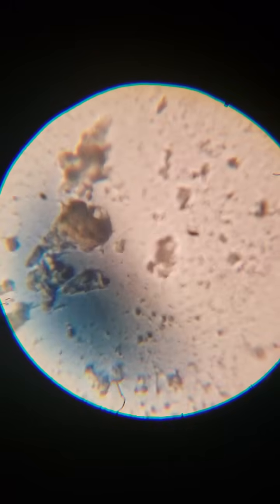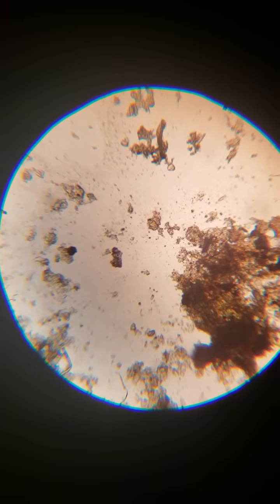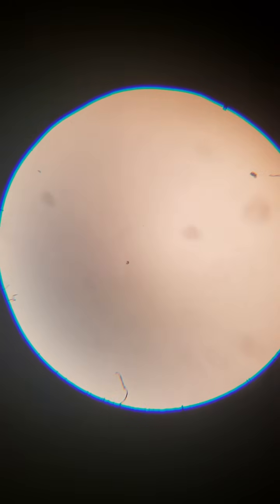But yeah, there's just an incredible world in here. And I just wanted to make it clear that once you have the microscope, you're not just making things up. You're actually seeing a whole world and able to decide what the heck you're looking at. So that's what your filter floss looks like when it's scraped.